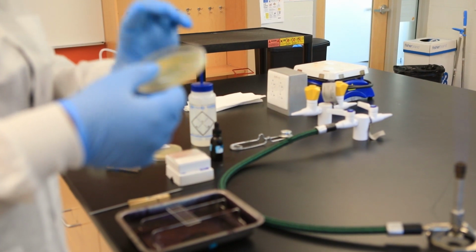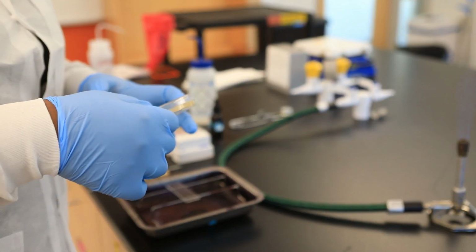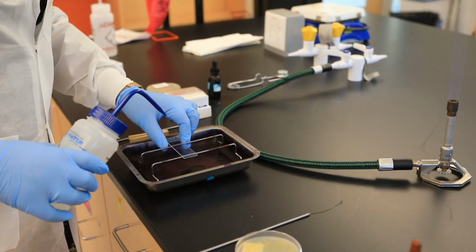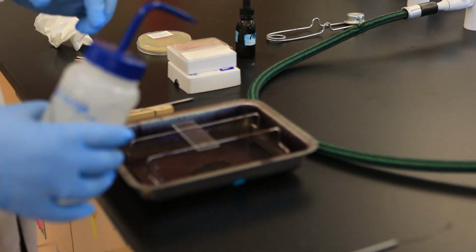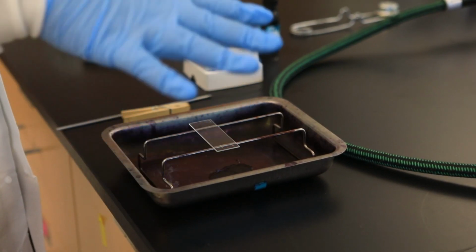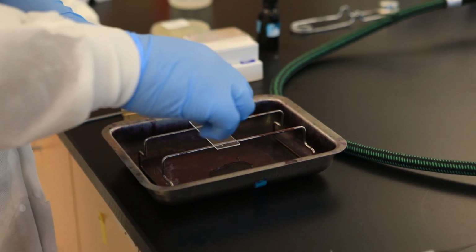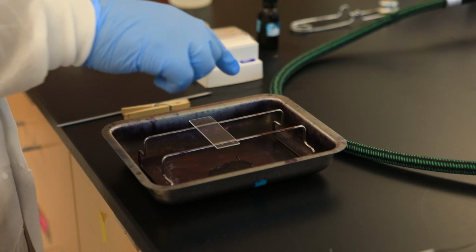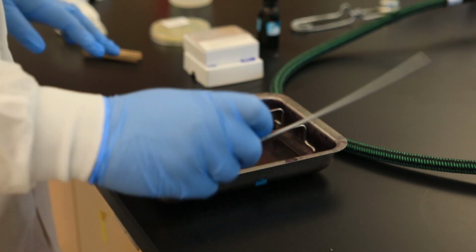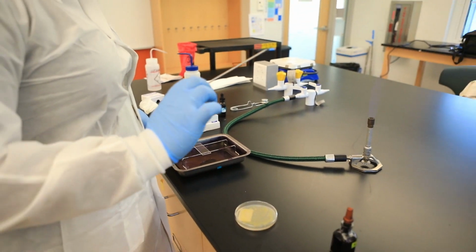So since it's growing on a solid surface, we have to introduce water to mix the bacteria, okay? So what I do is I add, try to make it small, but it's okay if it's not small, a drop of water towards the end of the slide. I don't do it in the middle. Okay, and there's a reason why, and I'll go over that in a moment. I do the small droplet of water at the edge of the slide. Once I do that, now I'm ready to sterilize the inoculation loop, okay?